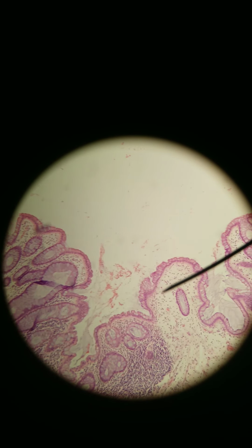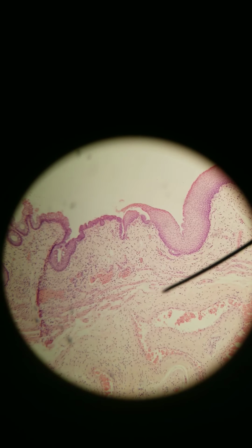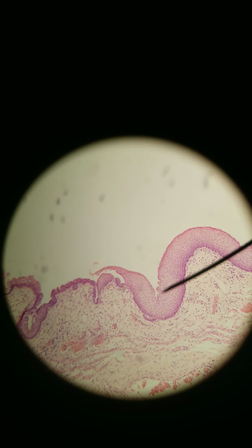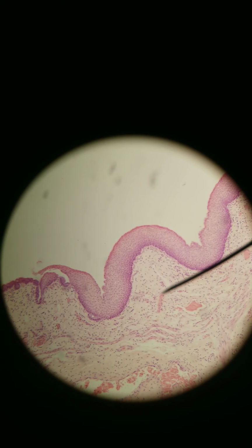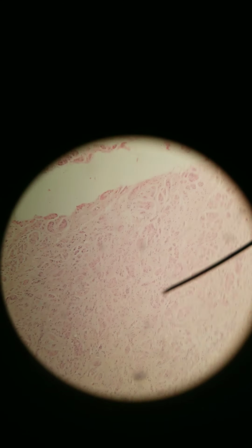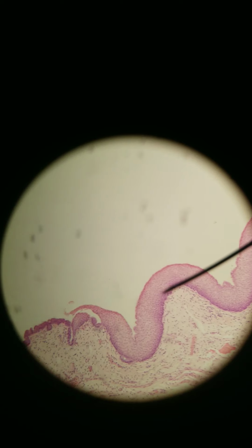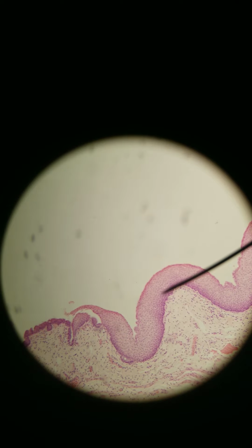We're in the rectum, and we're going to transition from simple columnar, lymphoid follicle, simple columnar to stratified squamous. Simple columnar over here. Let me go, I'll get closer in a second. Stratified squamous. We're transitioning to the anus. The anus, of course, is the opening where we can defecate out of, and there are two sphincters which are made up of that muscularis externa, but you can't just decipher them here easily. But two sphincters: the internal anal sphincter, which is autonomically controlled, parasympathetic reflex, and external anal sphincter, which is skeletal muscle, which we can consciously control.